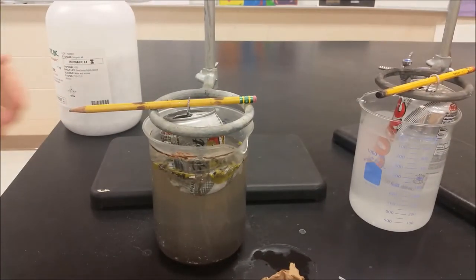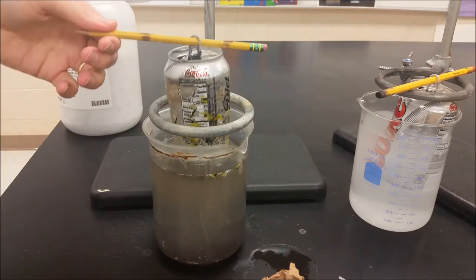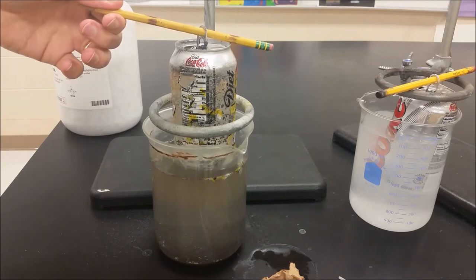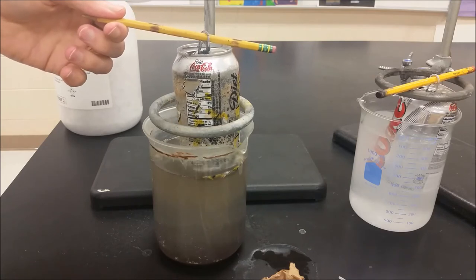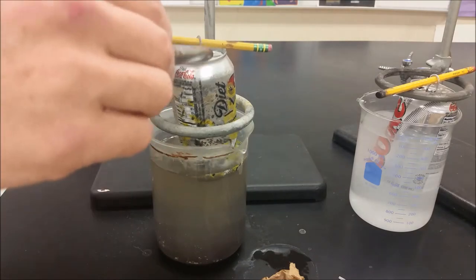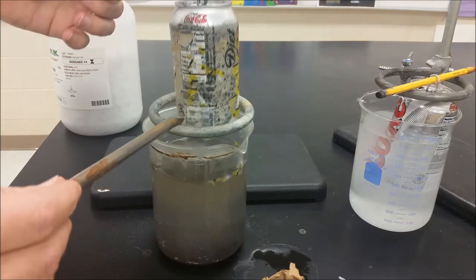So this was a Diet Coke can two hours ago and the only thing remaining now is the plastic film that goes on the outside of the aluminum can, because all the aluminum has been dissolved after the reaction except for some up here at the top and a little bit down at the bottom as well.